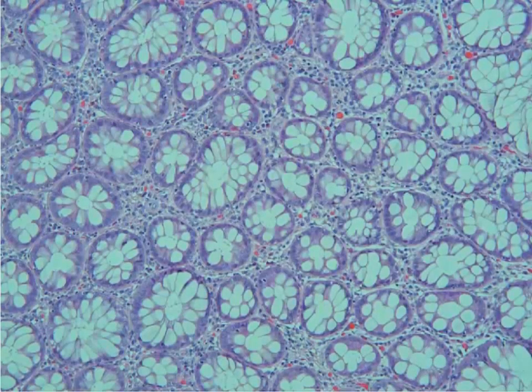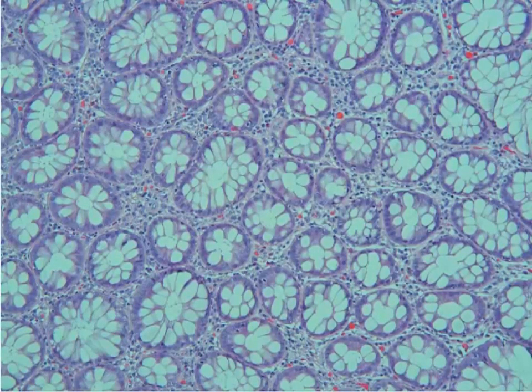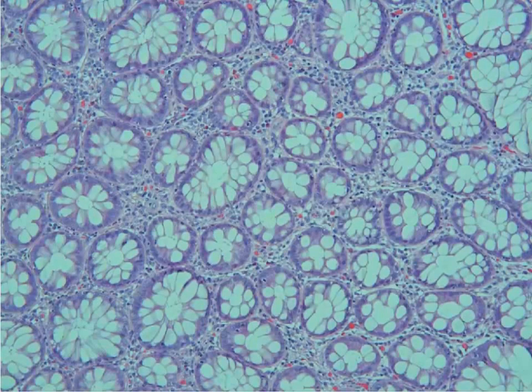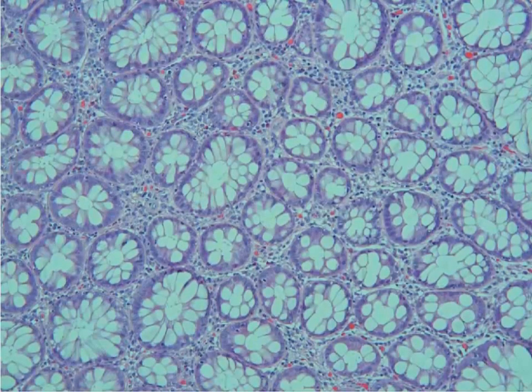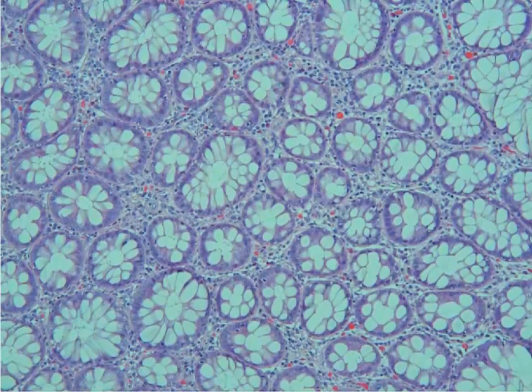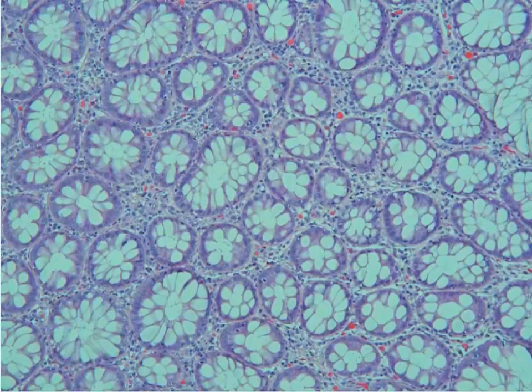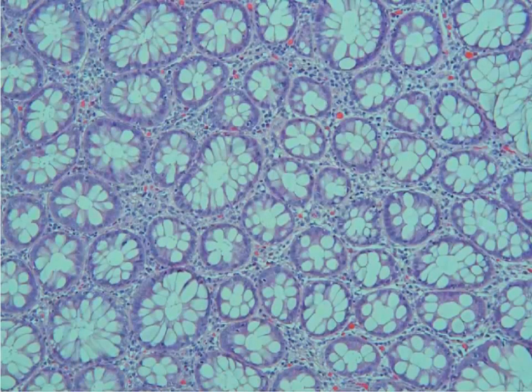In this case we're going to be looking at some of the features of neoplasia. What we're looking at today is a colon biopsy — this patient was seen to have a large polyp within their colon.